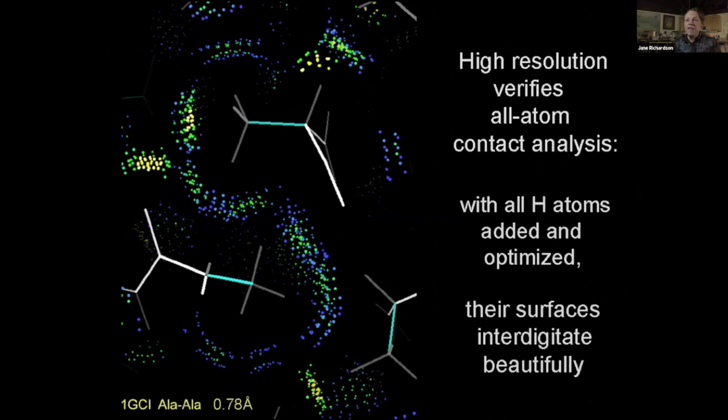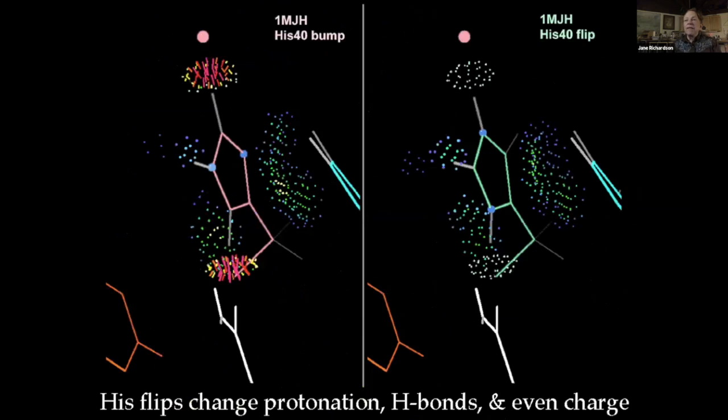So the reason we believe this is that indeed all atom contacts look marvelous in the good parts of high resolution structures. And you discover when you start paying attention to them that you can really improve things. So here's a histidine, which happens to be at an active site. And in the original structure, it had a clash to this water. Well, okay, so that's not such a big deal, but it has a clash to a backbone carbonyl oxygen, which is an obligate acceptor, and yet it's a CH instead of an NH that's pointing at that atom. And if you flip over the histidine, then you get hydrogen bonds, really nice hydrogen bonds to both, in both directions.